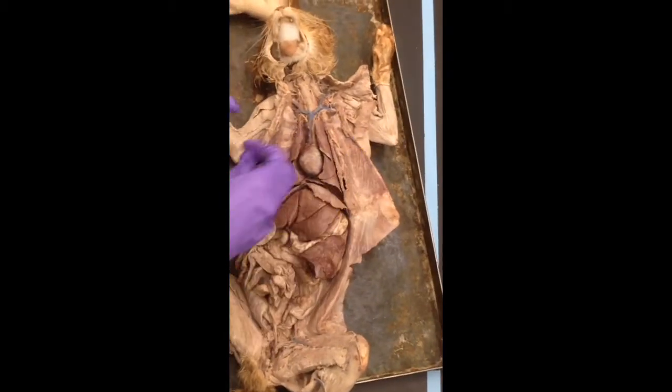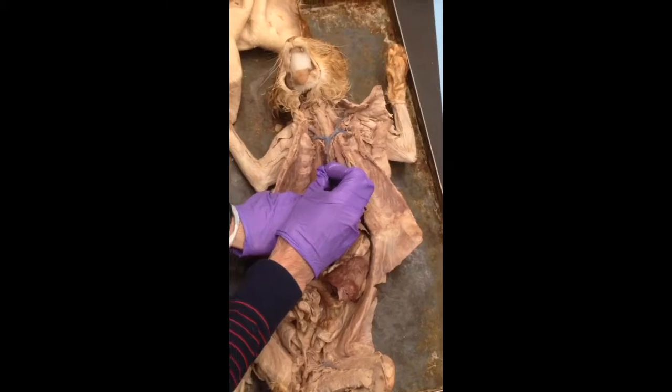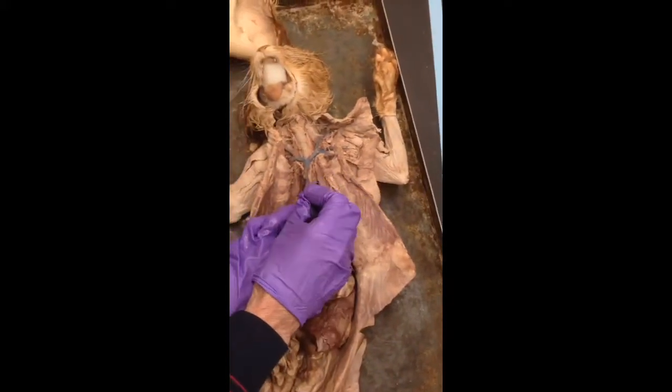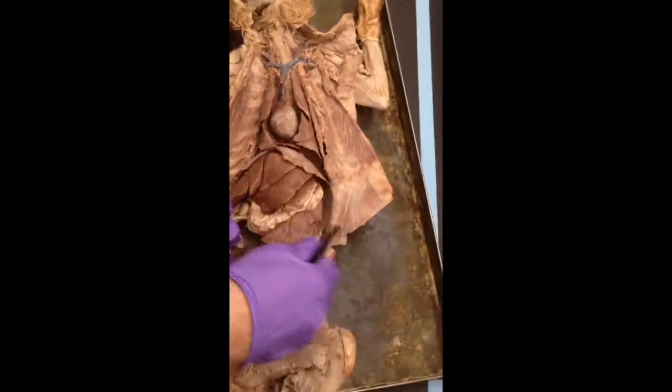Any of these arteries or veins, what are those going to be? Coronary. Coronary, okay. They're good. So you're going to have the pulmonary arch and the aortic arch in there. The pulmonary arch is going to be down here. The aortic arch is going to be up there. The precava goes up. Postcava goes back.